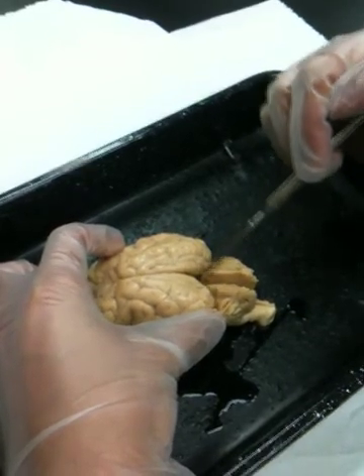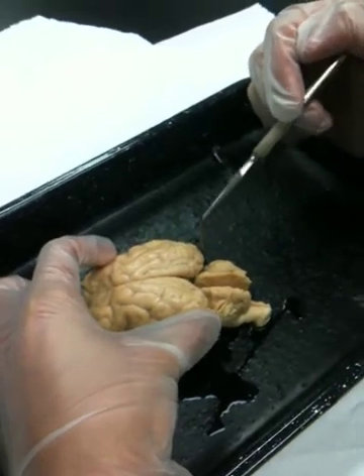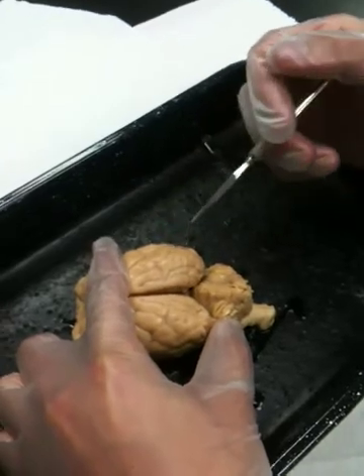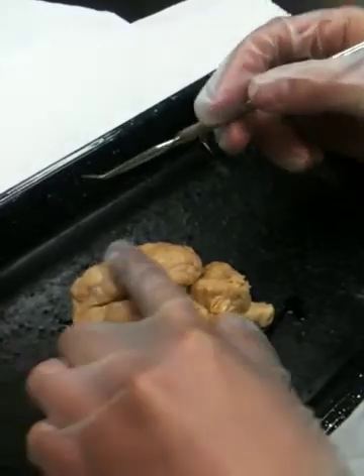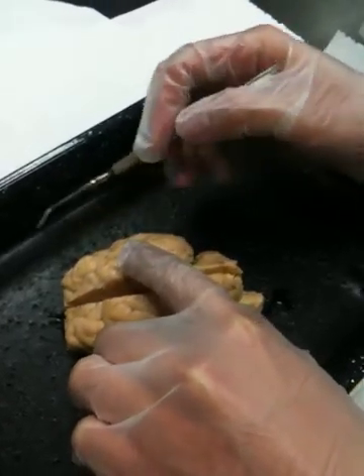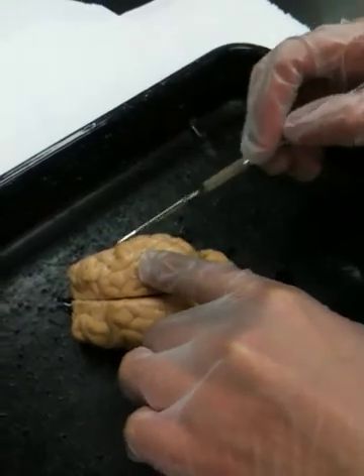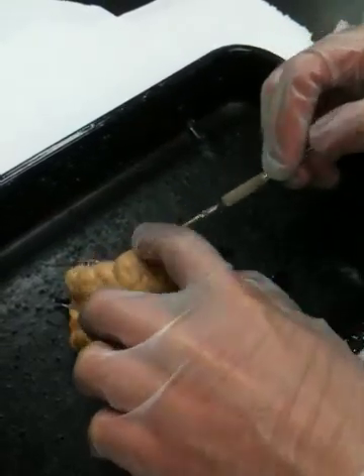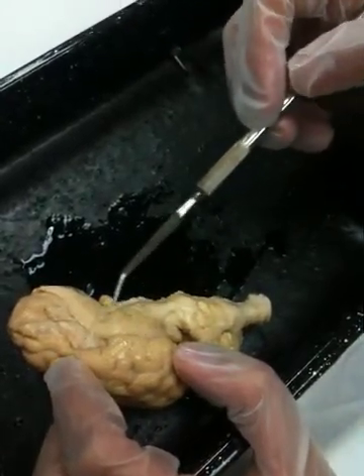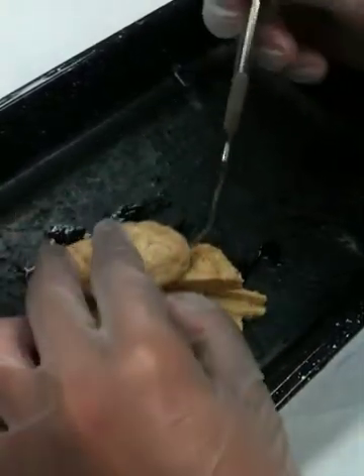Transverse fissure. The cerebrum is divided up into lobes, the same way that you divide up the bones of the skull, and they're named in the same fashion. So we have a frontal lobe here on each side, parietal lobe, sides of the cerebrum, the temporal lobe, kind of stuck a little bit down underneath here, and the occipital lobe, which is the back portion of the cerebrum, beneath the occipital bone.